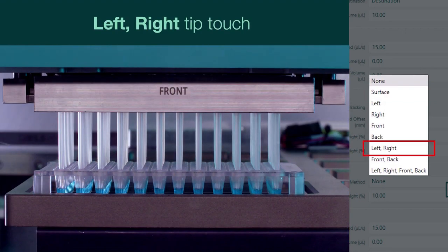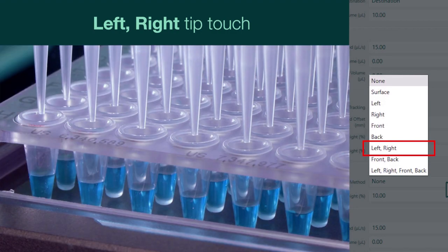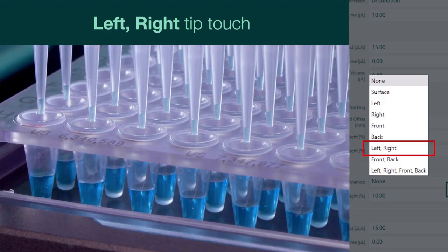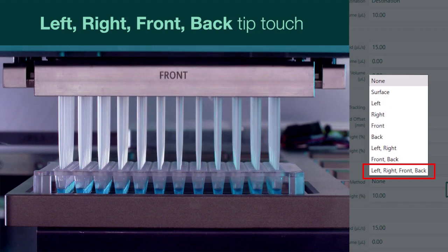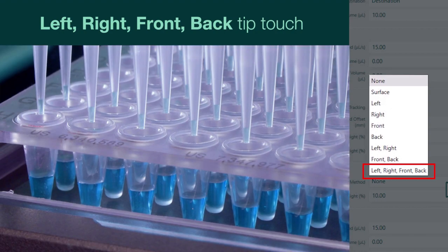A side tip touch, such as left-right, is when the tip touches the side of the well. This can be just once, such as a left tip touch, or up to 4 times with a left-right front-back tip touch. A left-right tip touch is added by default to the dispense to ensure clean tips at the end of a transfer.